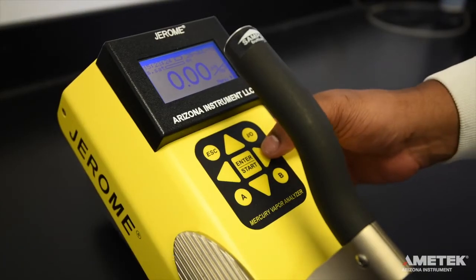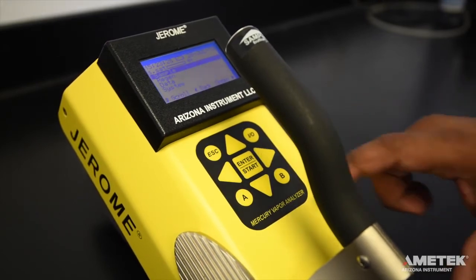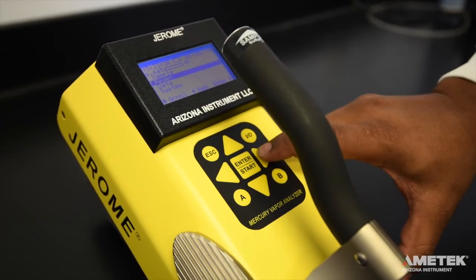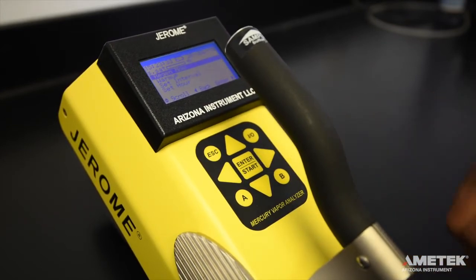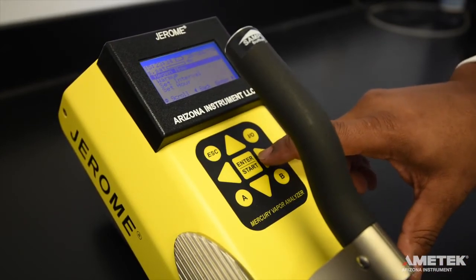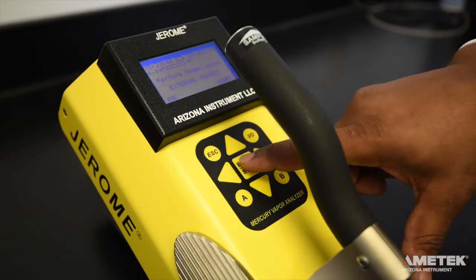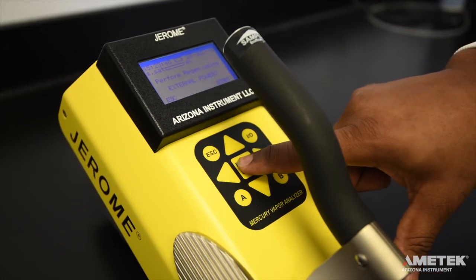Press the right arrow button to enter the main menu, then press the down arrow button to move the cursor to regen. Press the right arrow to select regen now on the regen menu. When prompted to confirm your choice, press enter to proceed, or press escape to cancel.